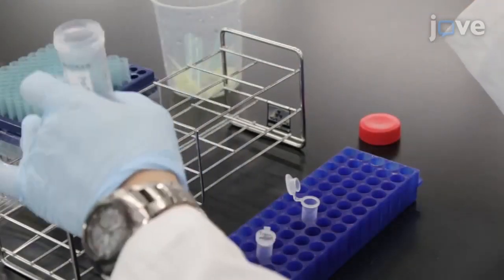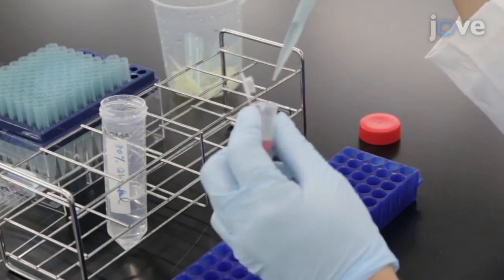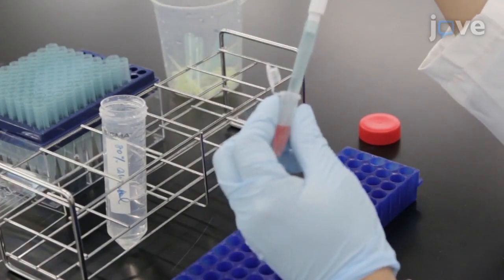To prevent freezing, add 80% glycerol to the samples for a final concentration of 50% glycerol.